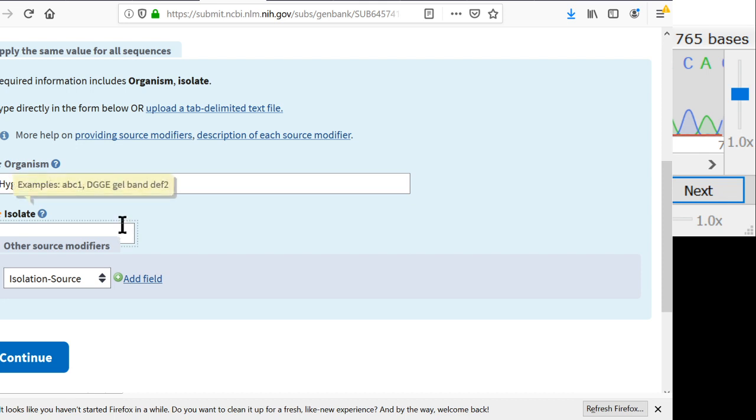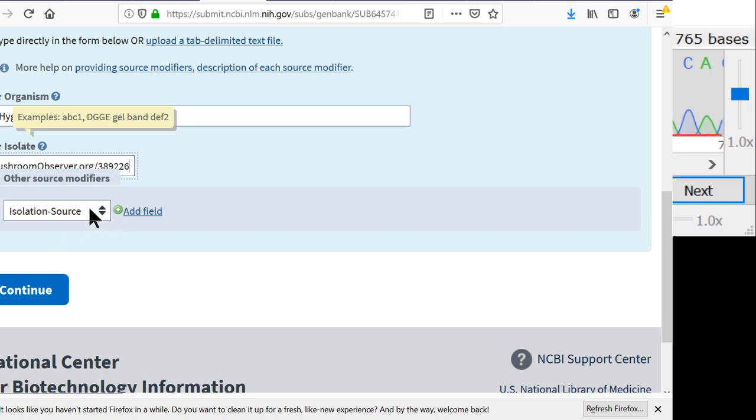And isolate, here's where I put in my Mushroom Observer number, and this is what you actually see in the BLAST results. And so now I have my unique identifier in there. And now we have the option to add all these other source identifiers. And you definitely want to put some of these in. I would say the most important one is country. Because a DNA sequence is a whole lot more useful if you know where in the world it came from.